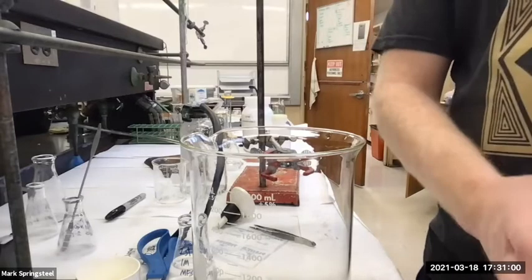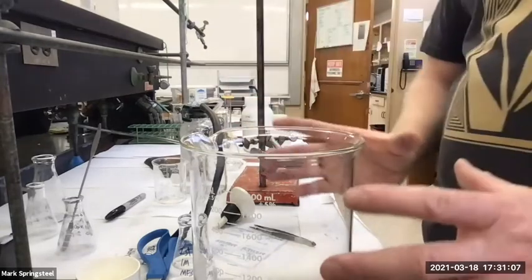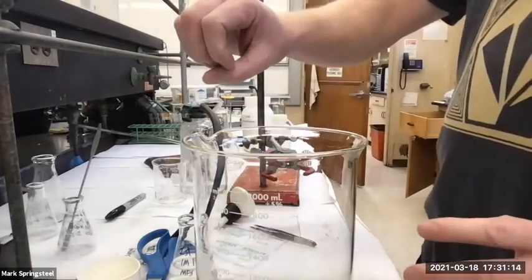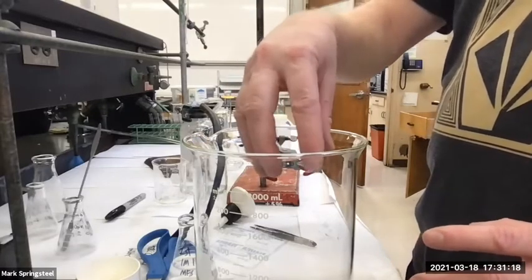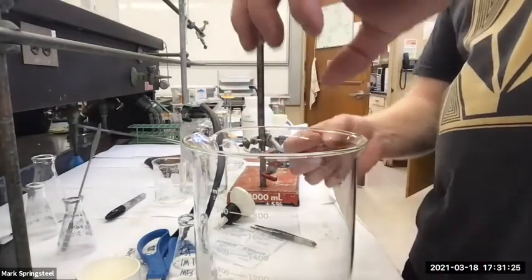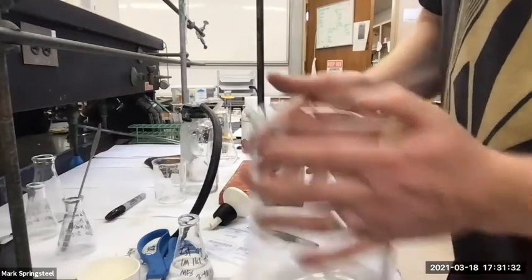So if you add the strong concentrated acid to water slowly, it's going to heat up and react, but it's going to be cooled by that water, and it's going to absorb all that heat. Whereas if I have concentrated sulfuric acid here and add some water to it, it's mostly sulfuric acid, and that's not good at containing the exothermic heat, and it could splash out concentrated sulfuric acid on me. I'd rather add the concentrated sulfuric acid to water, and if it gets too violent, it's splashing out mostly water on me, which you still don't want, but yeah.